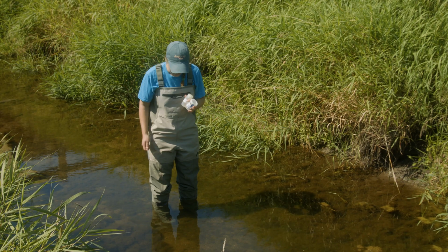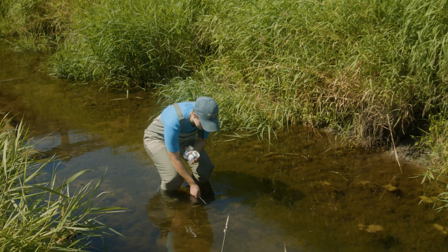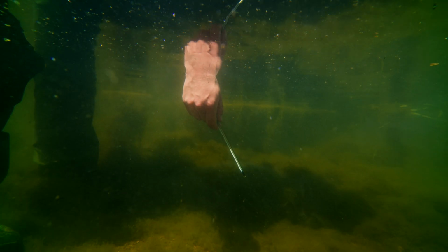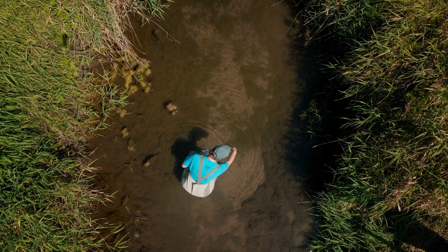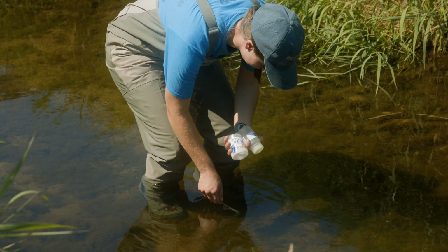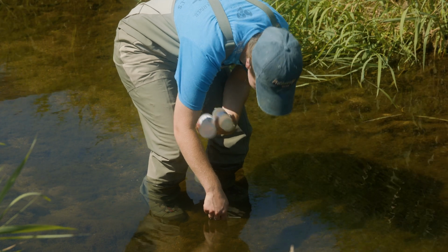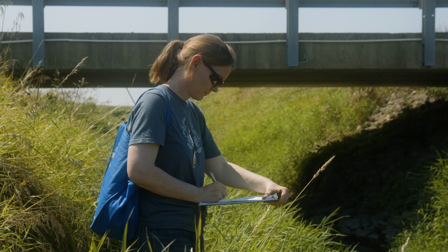Once the sediment has settled around you and you are ready to sample, start by taking the water temperature reading by submerging the colored bulb on the thermometer into the stream. Hold the thermometer in water for at least 1 minute or until the temperature reading stabilizes. Read the value while the bulb is still in the water. Temperature is recorded in Celsius. Tell your partner this number to record on the data sheet along with the current time of day.